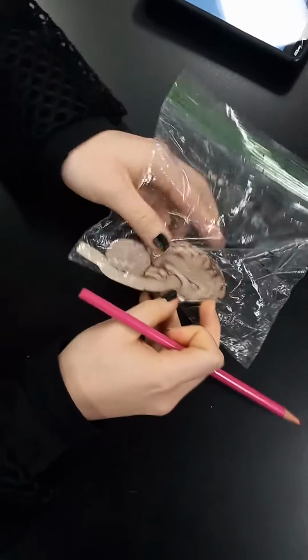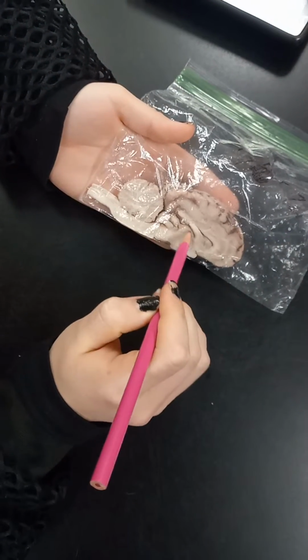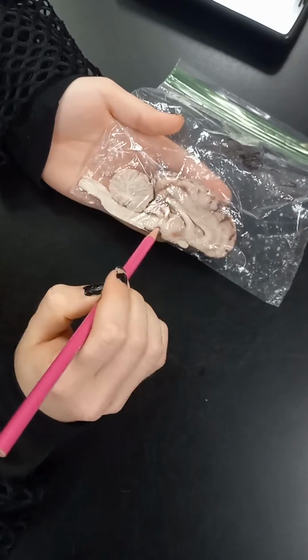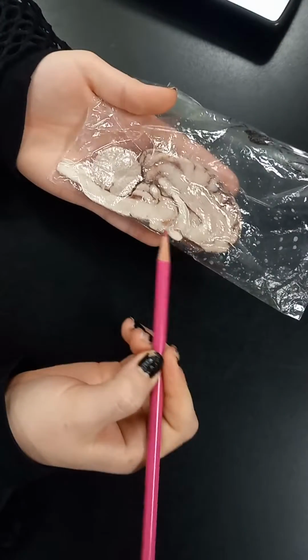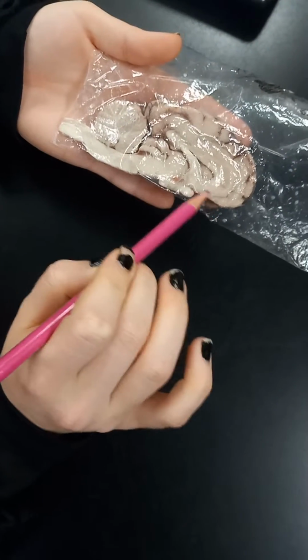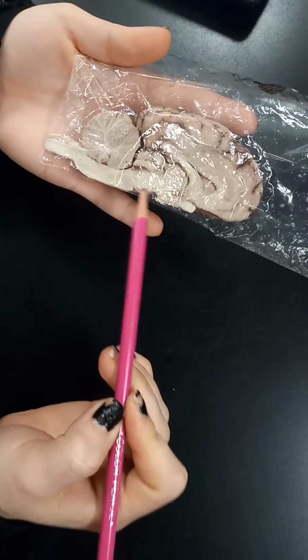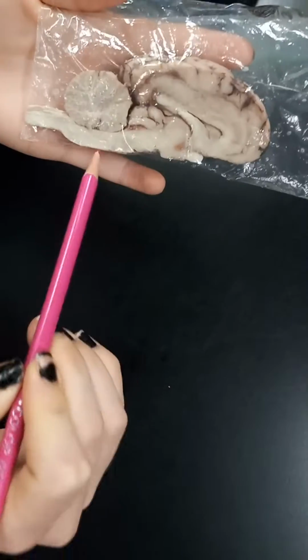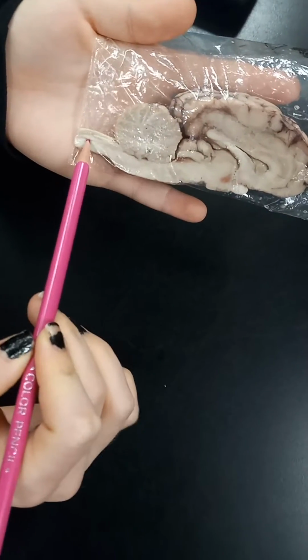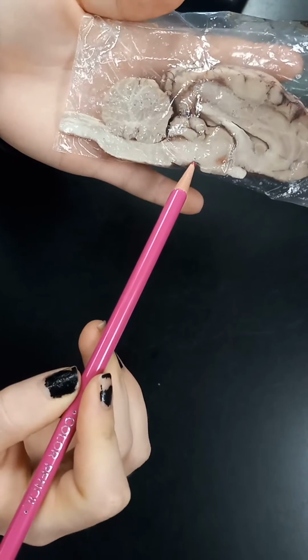So then when you flip it over, we have the thalamus, this circle, and underneath it is the hypothalamus. The hypothalamus is behind the optic nerve, and the olfactory bulb would be hanging off here. And so then back here behind the thalamus we have the midbrain, then we have the pons, the medulla, and the brainstem. And you'll notice that each of these is separated by just a little indent.